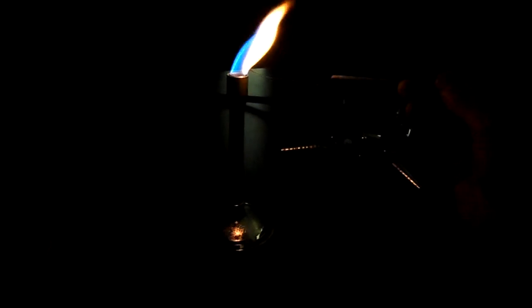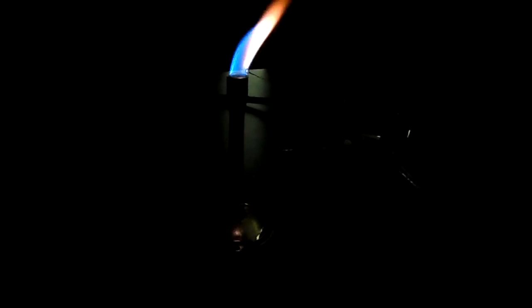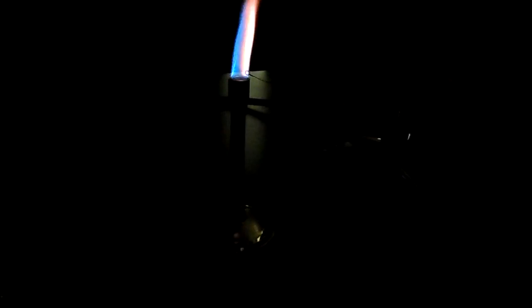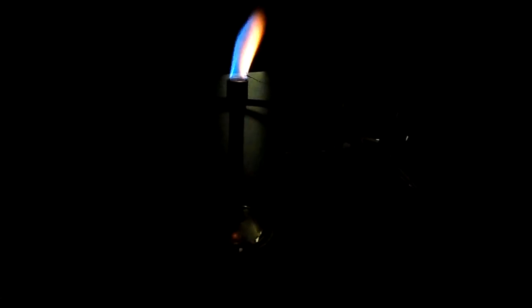Okay, and I'm seeing a violet color in there. Okay, so make sure you record that.